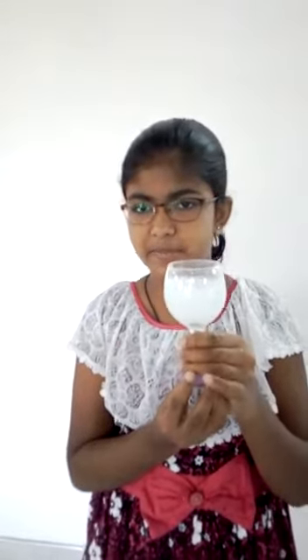Now, you can see that the colourless lime water has turned milky white. This happens due to the presence of carbon dioxide. Hence, the exhaled air contains carbon dioxide.